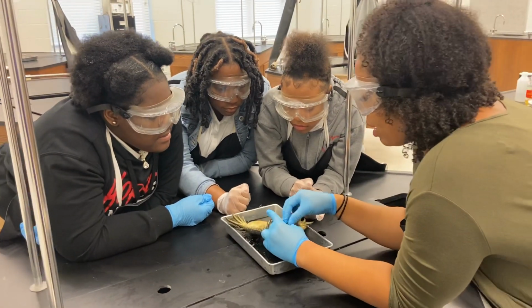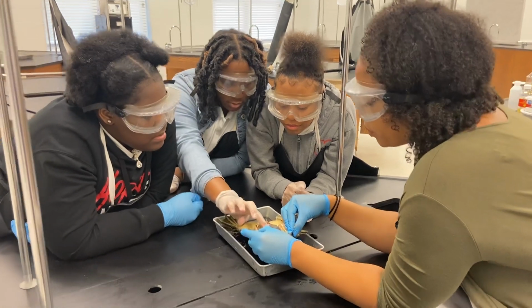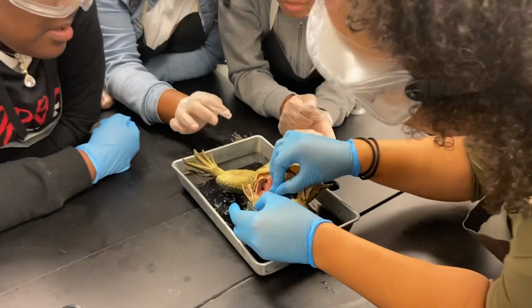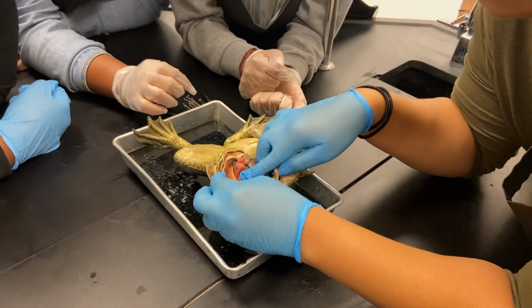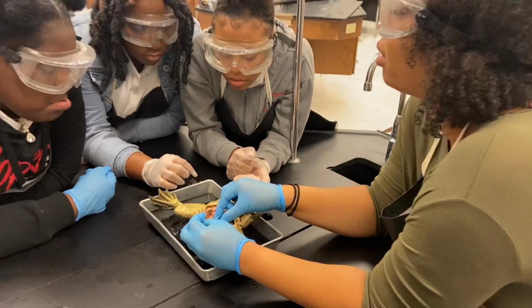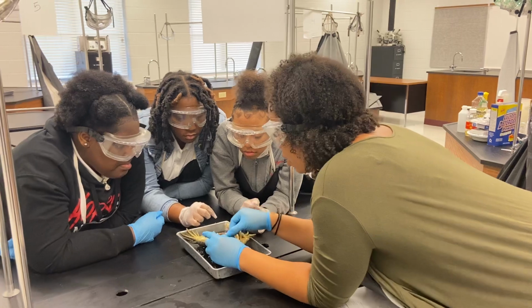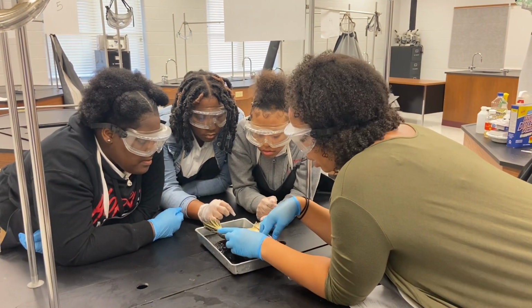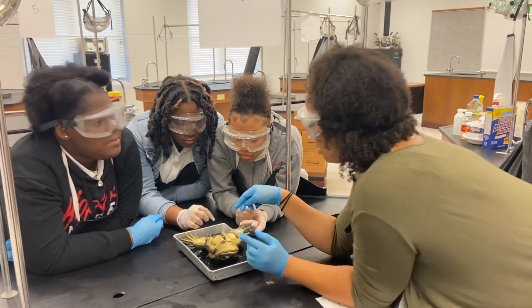Is there anything else about the frog that we didn't mention that you want to point out? I want to know what that is. What is this orange structure? I'm not actually sure what that orange structure might be. You could have fat pads and things like that in the frog, kind of as a supportive, temperature regulation type of thing. So we could say that could be what it is. But that's pretty much it.